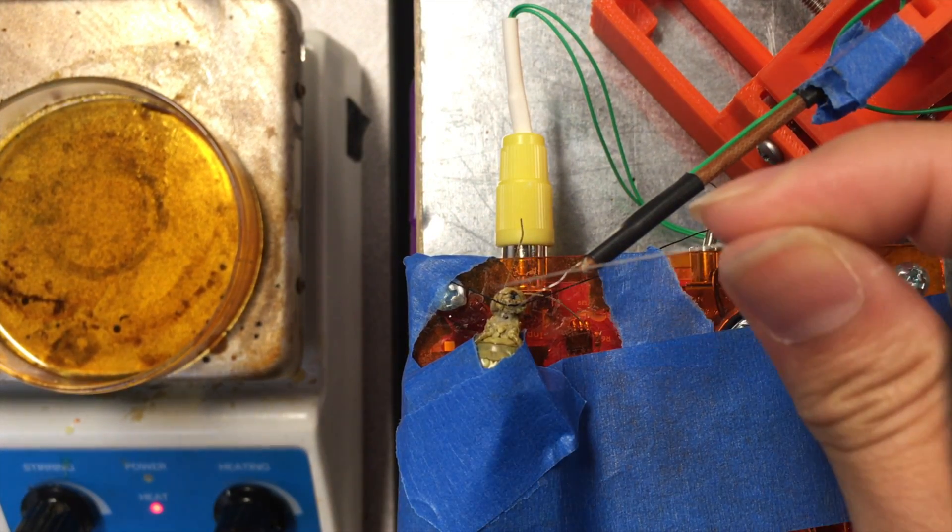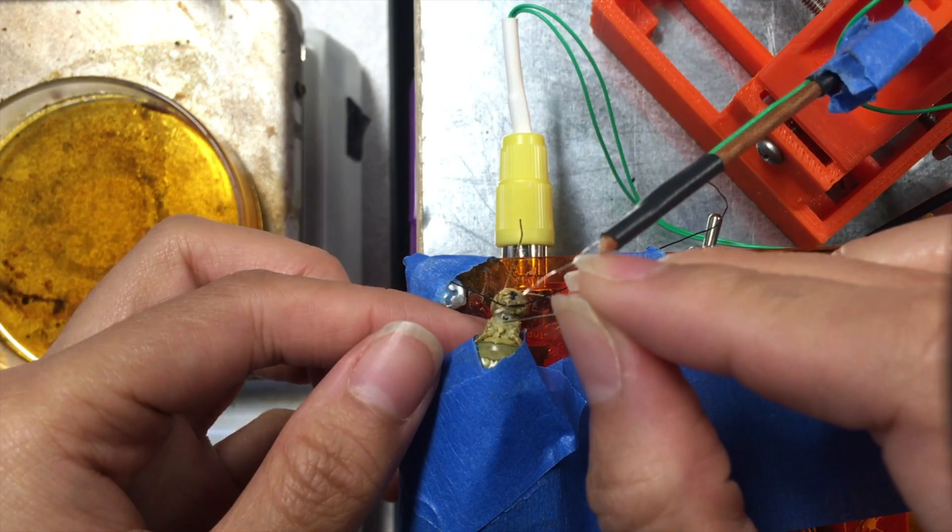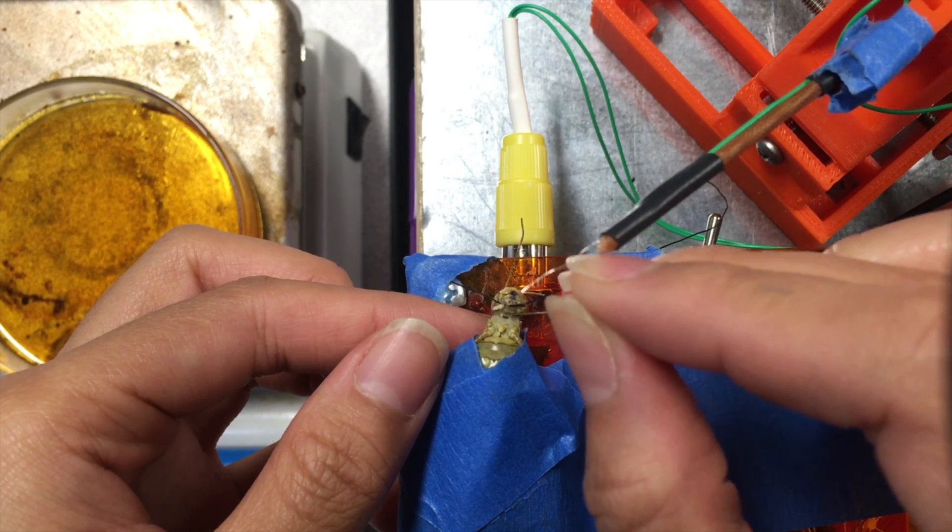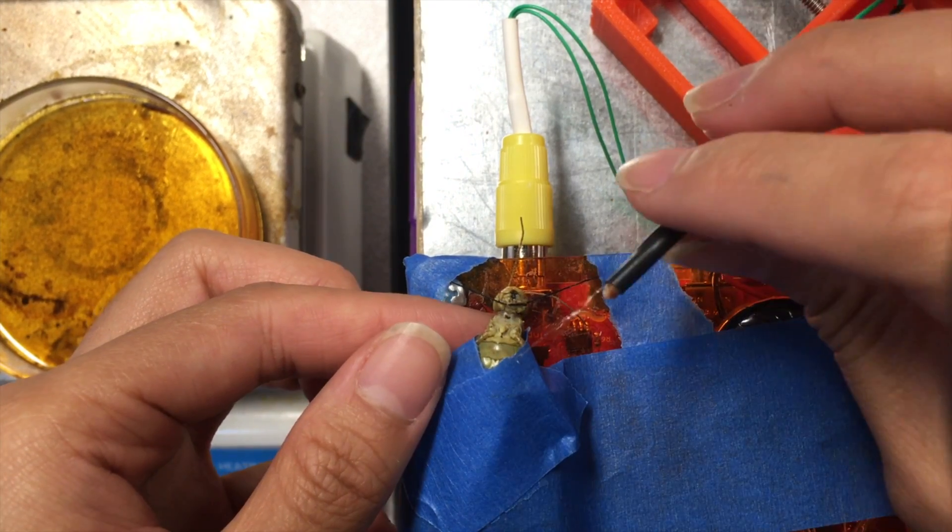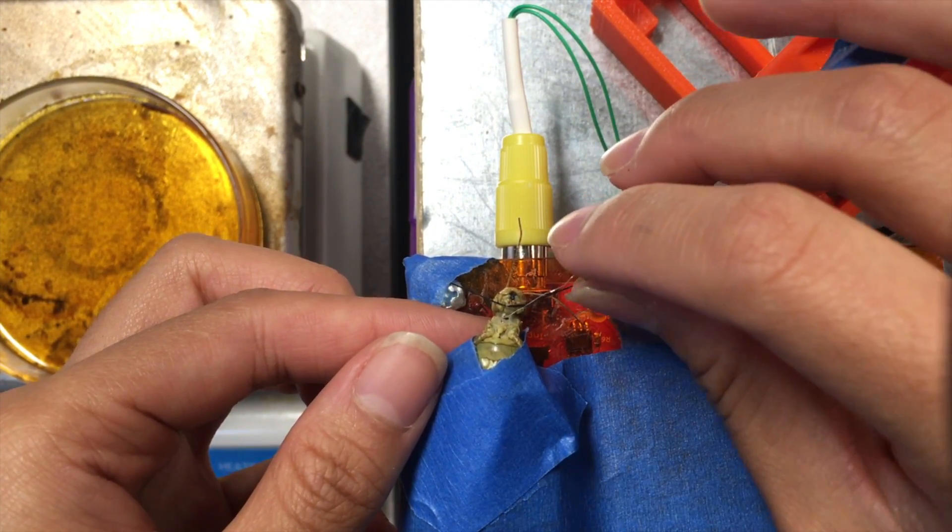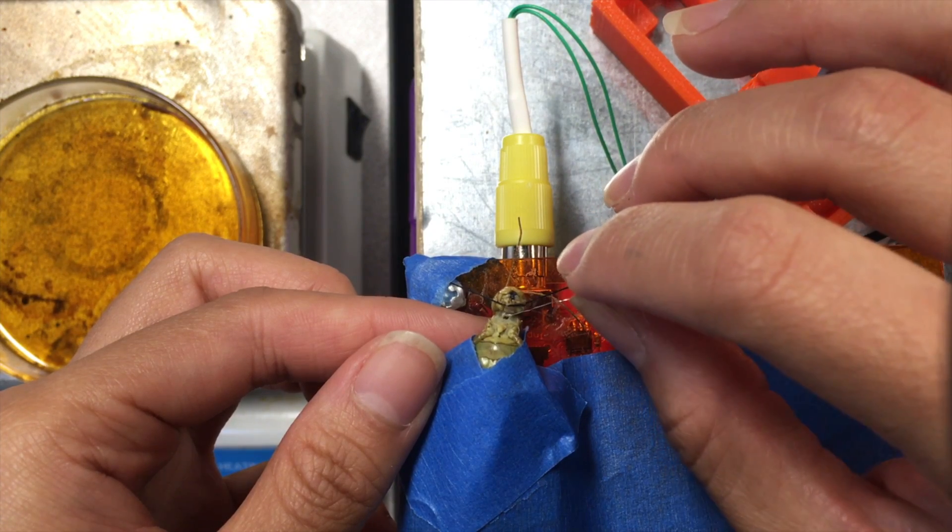Using a little pin, I will make an incision in the neck of the grasshopper, and that little incision is where the electrode will be placed.